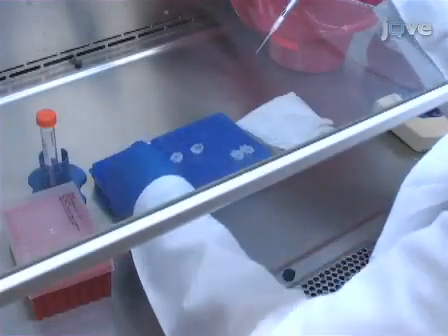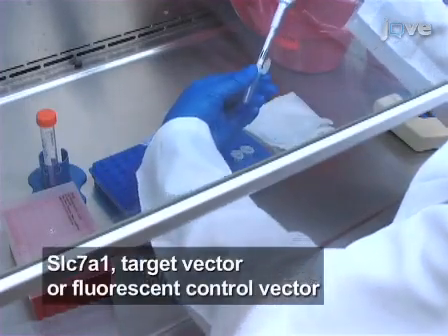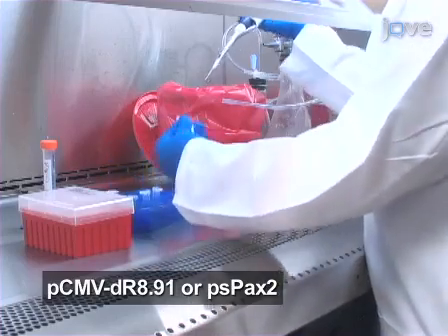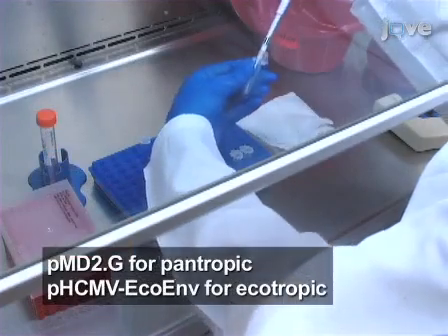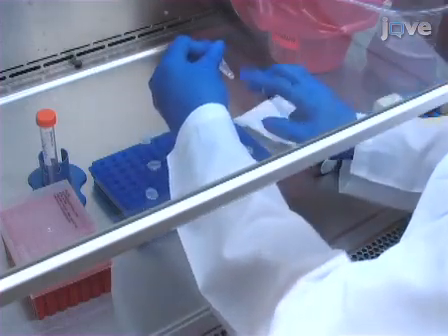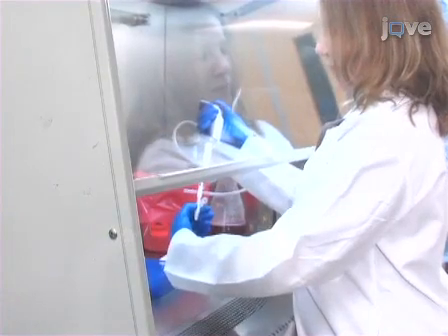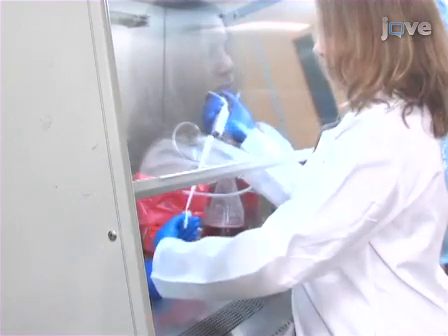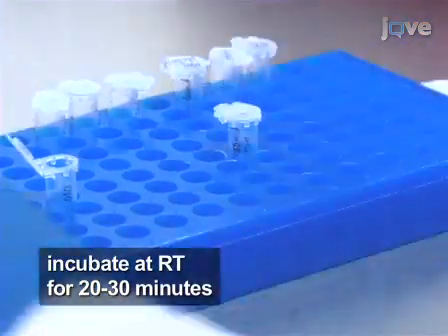Next, in a second microcentrifuge tube, combine 5 micrograms of the transfer plasmid, 3.75 micrograms of the packaging plasmid, and 1.25 micrograms of the envelope plasmid in the required amount of Opti-MEM to bring the volume to 100 microliters. Then, add the Opti-MEM FuGENE mix to the tube containing the plasmid mixture and incubate at room temperature for 20 to 30 minutes.